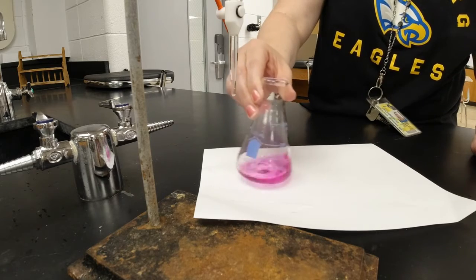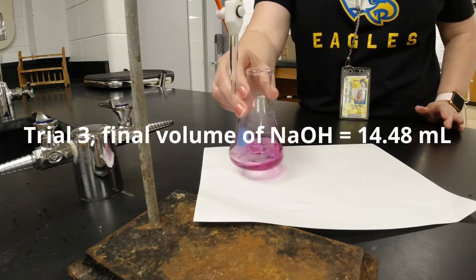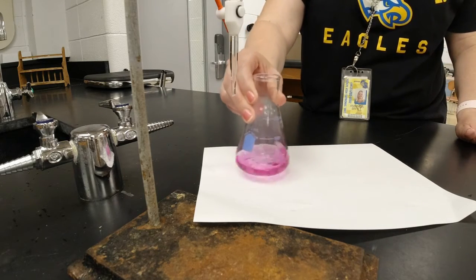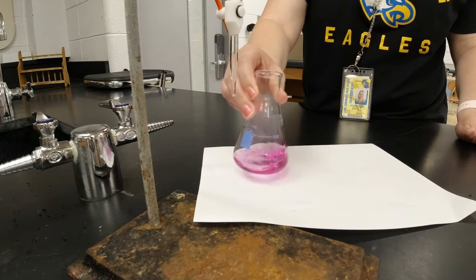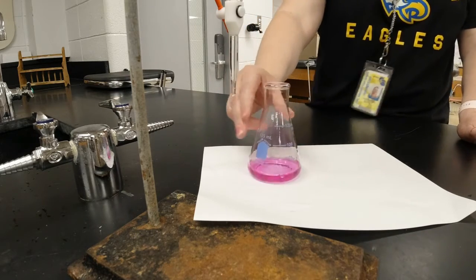So now let's read what we got here. And it says 14.48. 14.48. Okay. All right. It's not too pink? Nope, that's fine. All right. Thanks, Ms. Brill. I appreciate it. You're welcome.